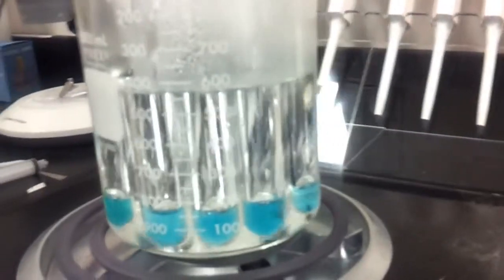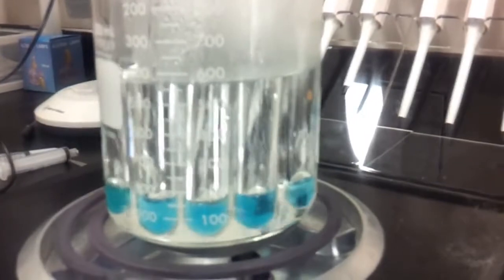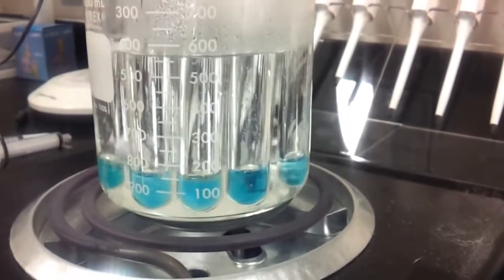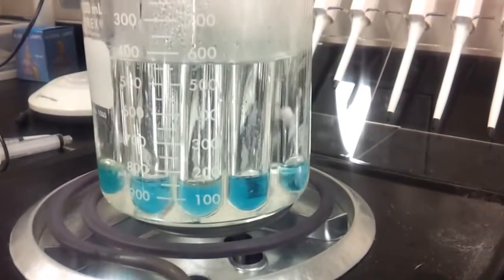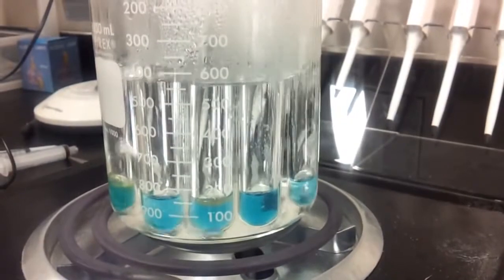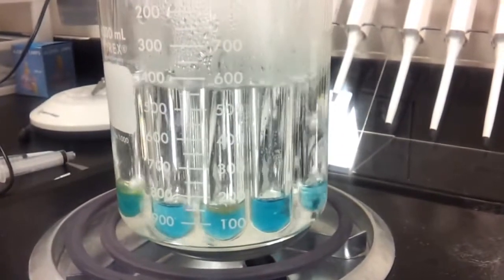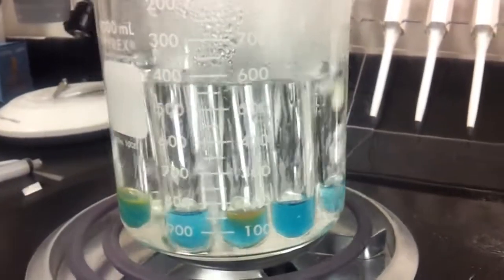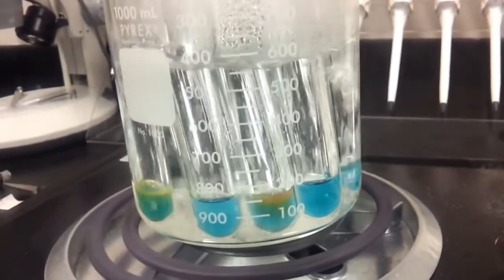So, we're going to go ahead and record down here at the bottom, and I want you to note the color change that happens. So, you can see that the solution in the middle and the solution on the far left are already starting to change colors.